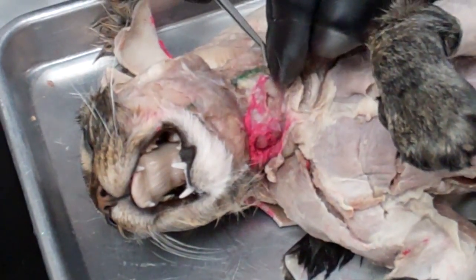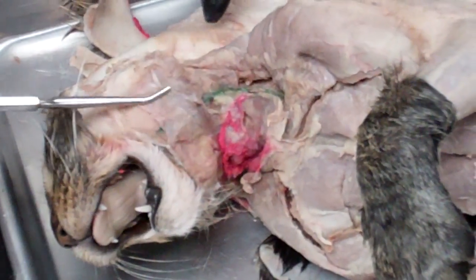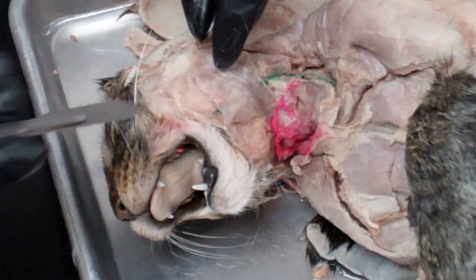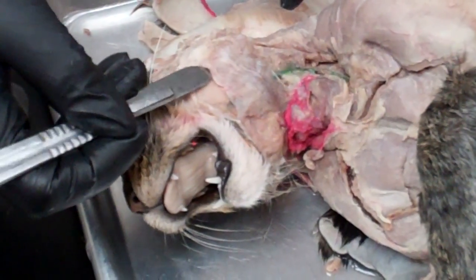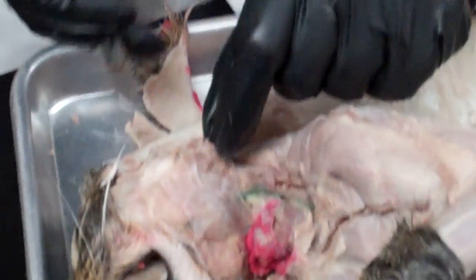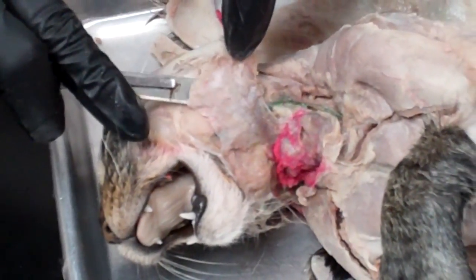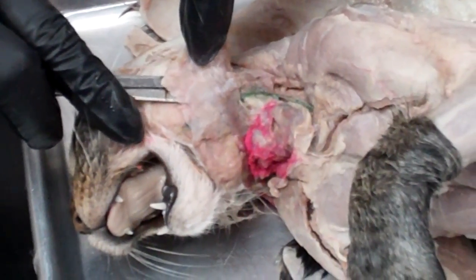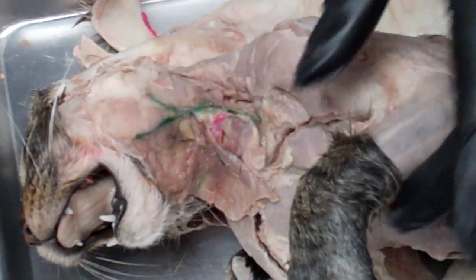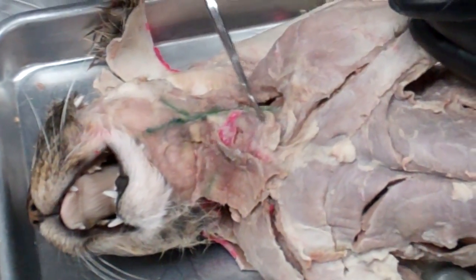The jugular vein is a fairly wide structure and runs up the neck of the cat. When you get up to the cheek area there is some overlying tissue to remove — make a shallow incision along there and remove this structure down to where you can find the blood vessel. Once you find it, you can peel underneath and remove the overlying tissue to reveal the branching of this blood vessel.